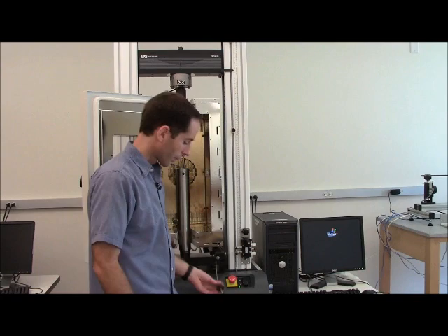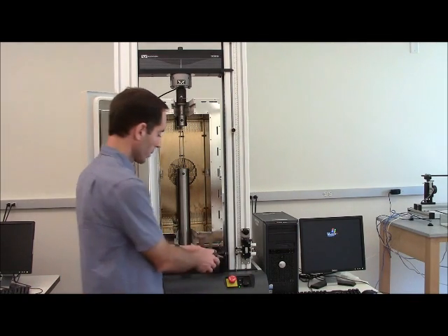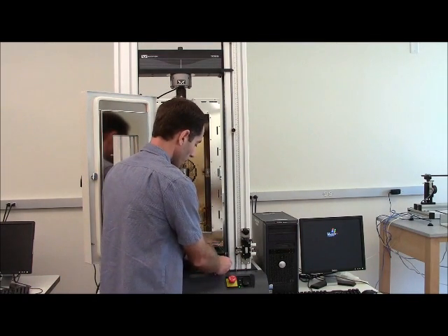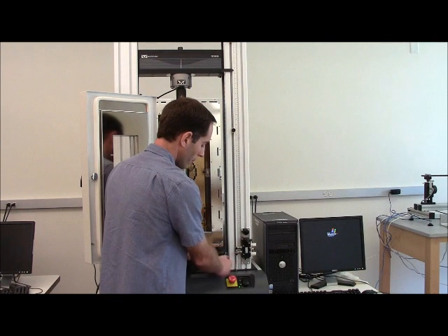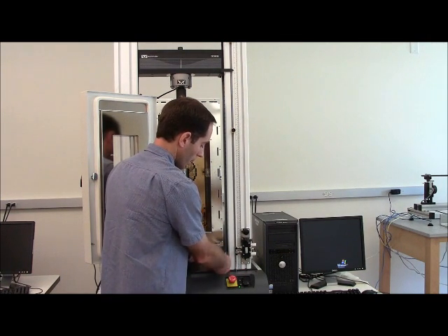With the oven in place I can take these bolts and this will keep the oven from sliding around. That's just one of them. There's one on the other side you would want to put that one in as well.